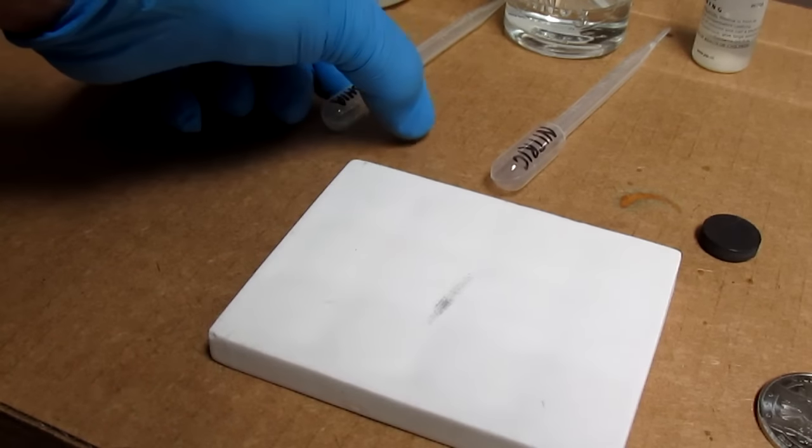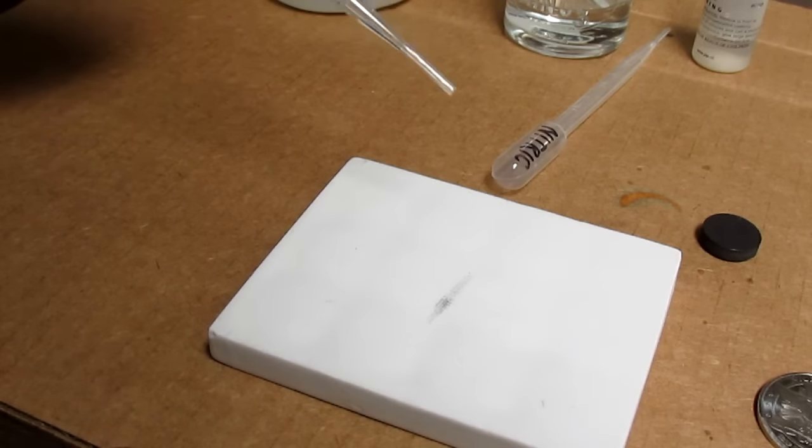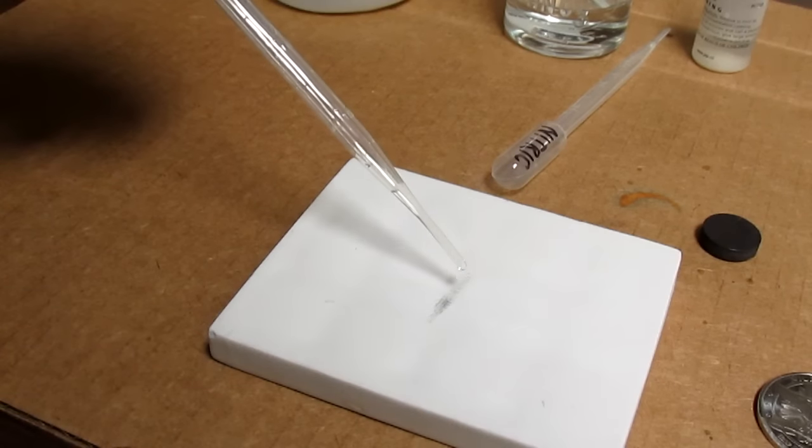The nickel didn't dissolve completely but I think I got enough in solution to perform this test. I'm going to neutralize that acid with some ammonia.